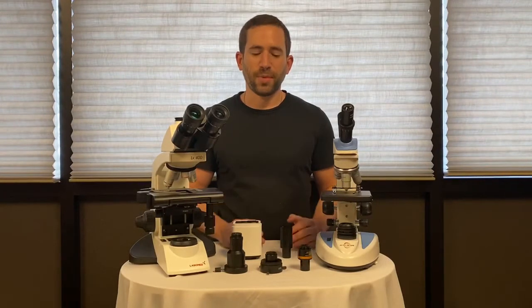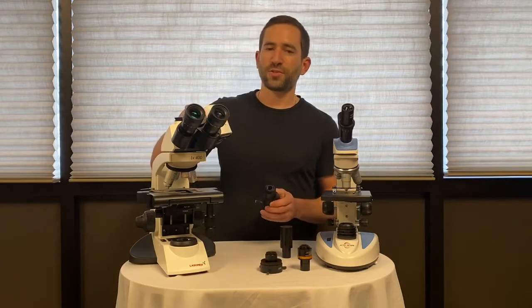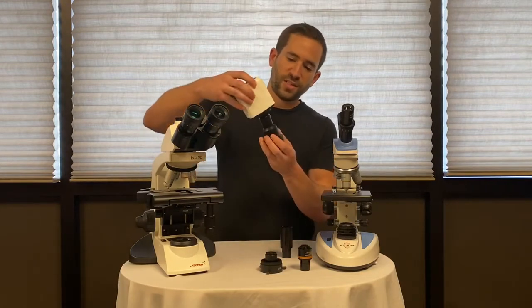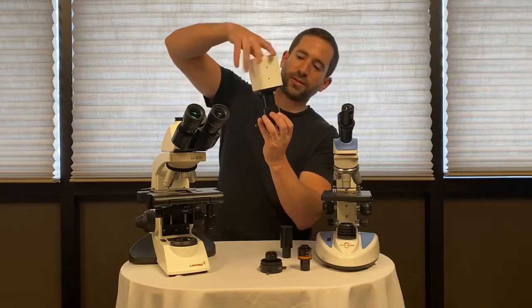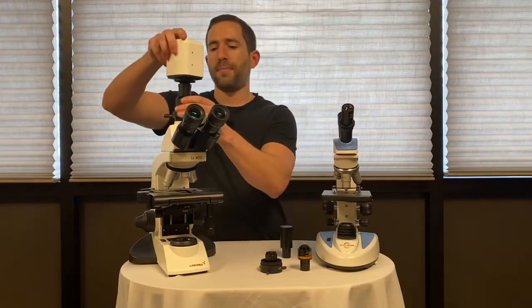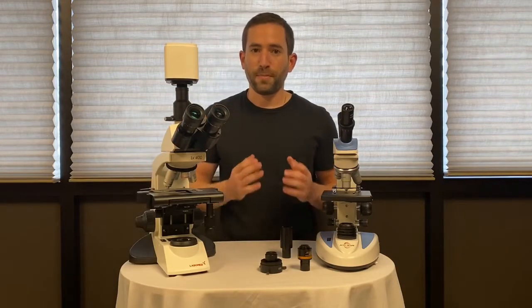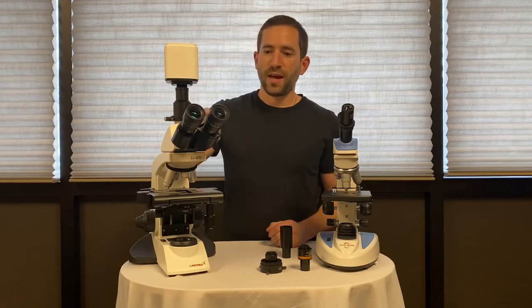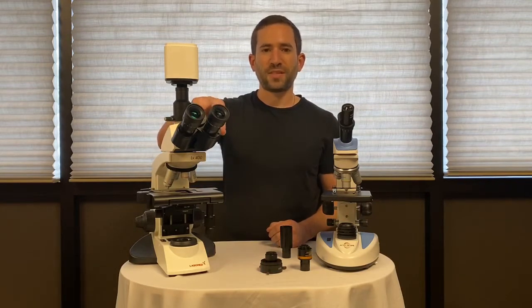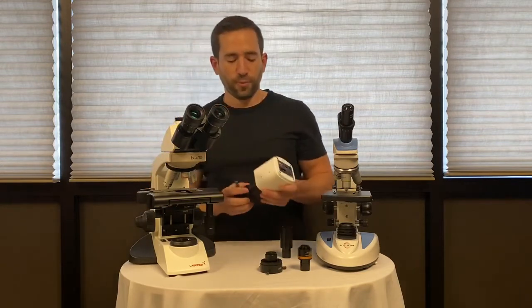You can add a camera to almost any microscope. The popular method is with a trinocular microscope and a C-mount adapter. Simply mate the camera and C-mount together by screwing the camera onto the C-mount and mounting it on the trinocular port of your microscope. This is the preferred method as it permanently mounts the microscope camera onto the head and allows you to view through both eyepieces at the same time.